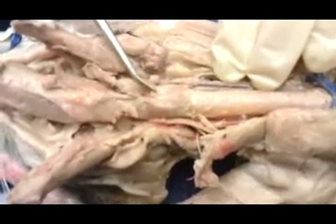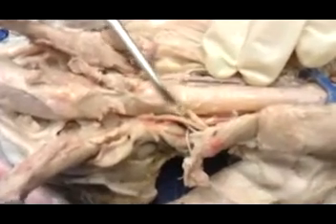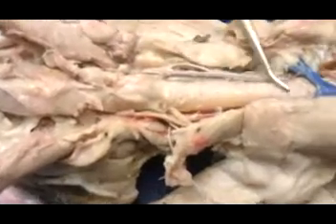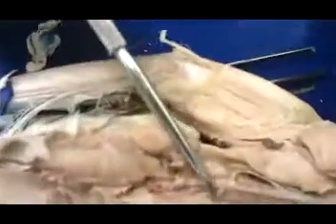The two main ones are the thyroid cartilage, the big shield-like cartilage above the cricothyroid muscle, and then below it is the cricoid cartilage, which basically is shaped like a ring. Then we have the trachea here with its C-shaped cartilage rings. The thyroid gland, this cat, unfortunately, it has been removed. There's going to be two little brown lobes, one on this side and one on that side.